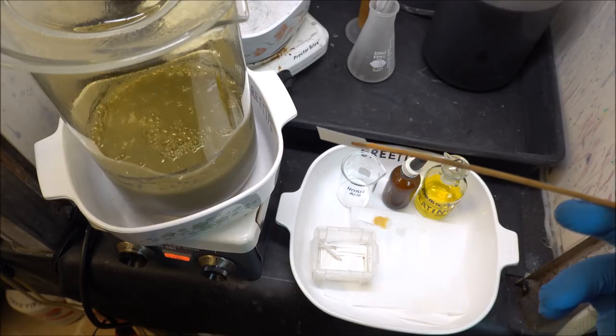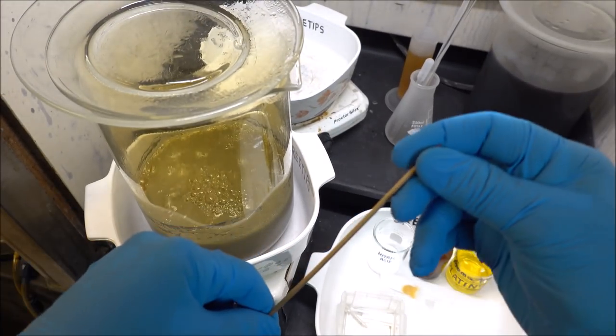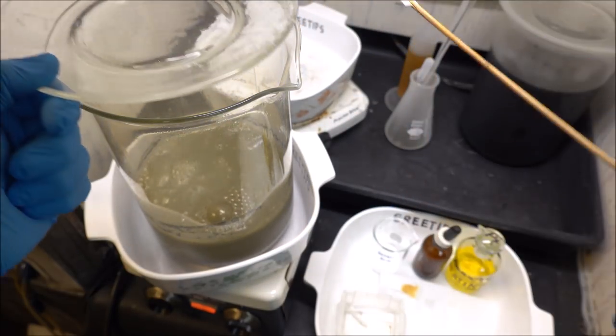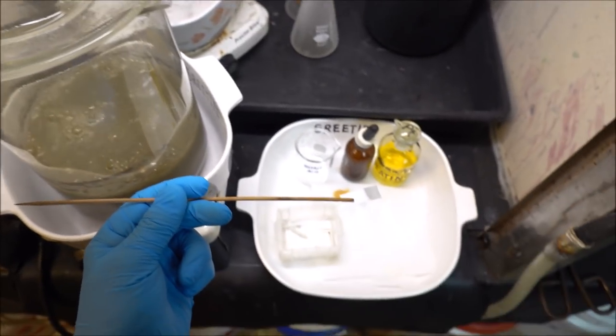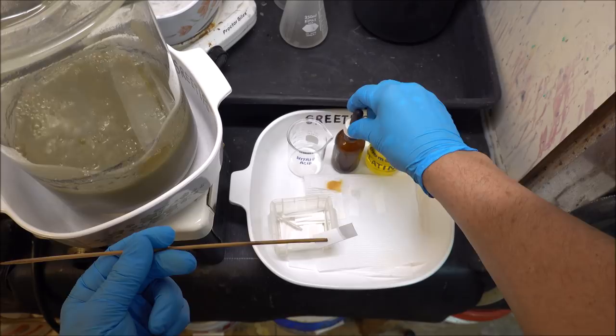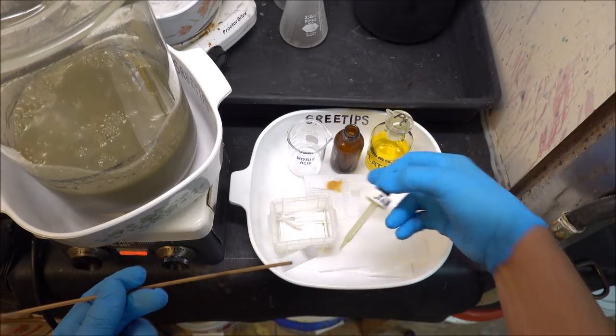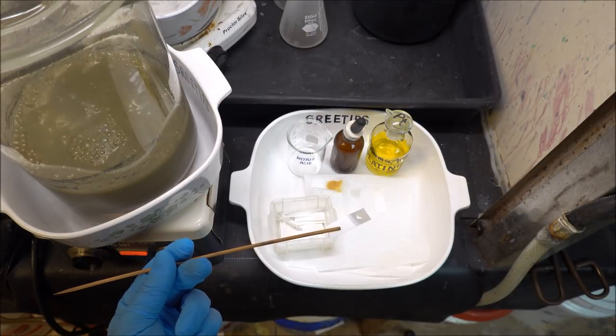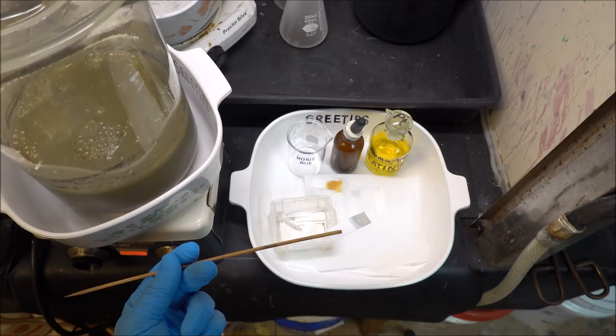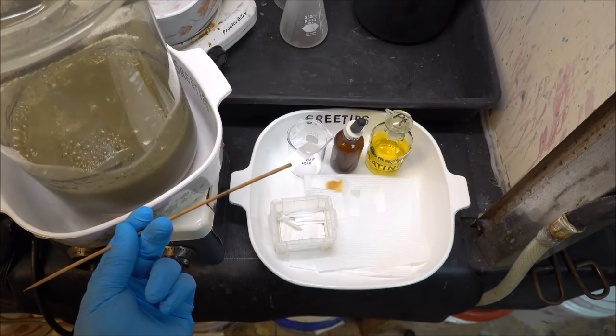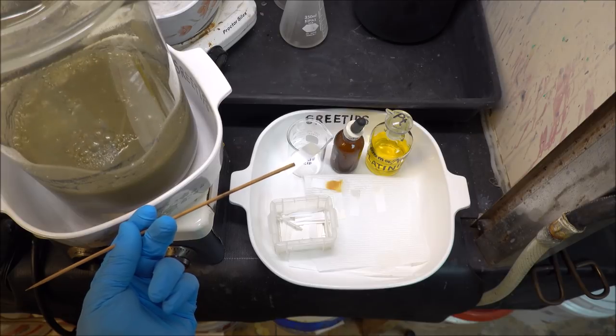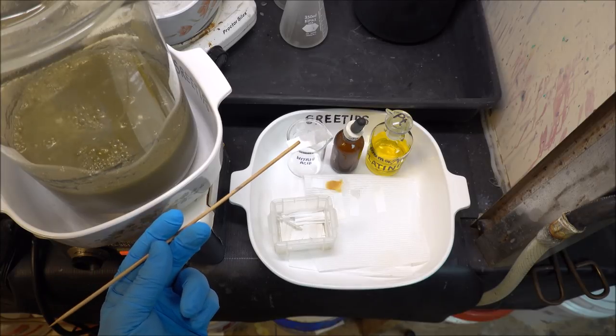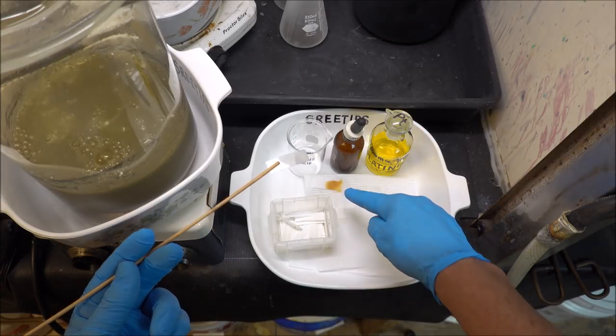I've got a piece of filter paper here. What I'm going to do is dip it down into our solution that's been boiling in aqua regia for about three hours now. I'm going to test this with my same stannous chloride testing solution that I used on this one. You'll notice that I get just an ever so faint indication. Just a very, very faint orange color there. Not enough to even hardly register with this very sensitive test.